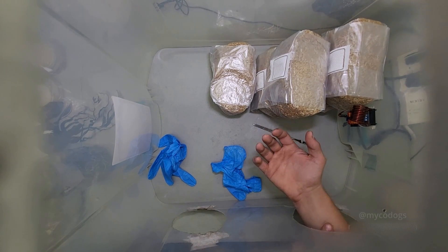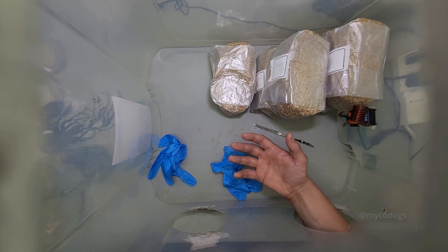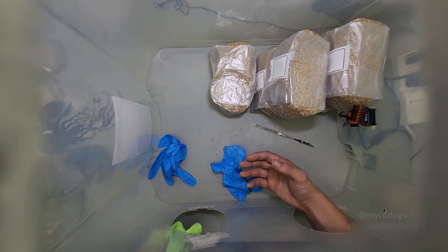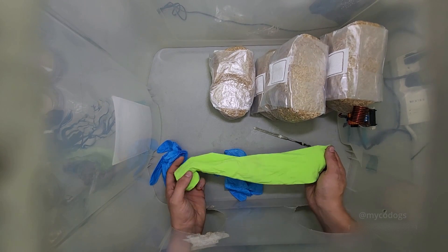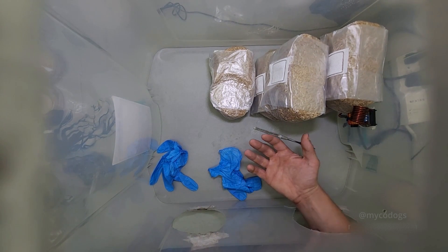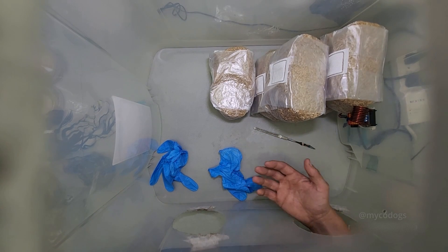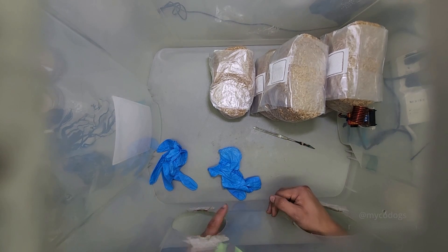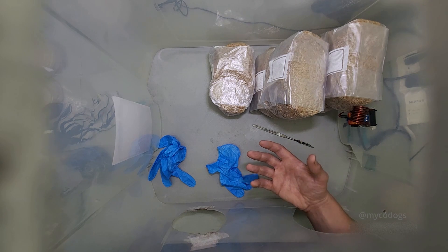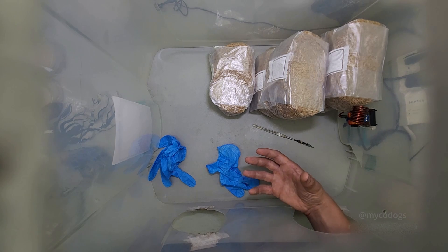As I mentioned before, you have a lot of dead skin cells and microorganisms living on your skin falling off. So it's often a good idea to use something like a long sleeve in order to cover up the skin that is exposed above your workspace. You often see me not doing that because I have developed my sterile technique to a point where I can feel pretty confident in working without that layer of protection.